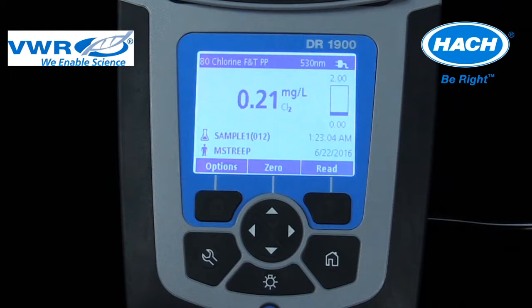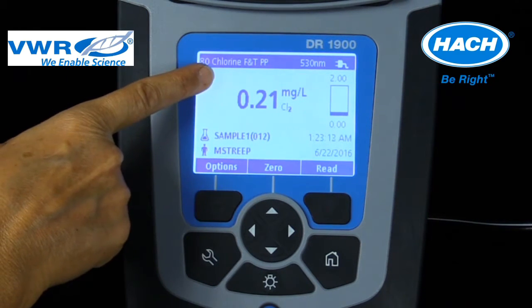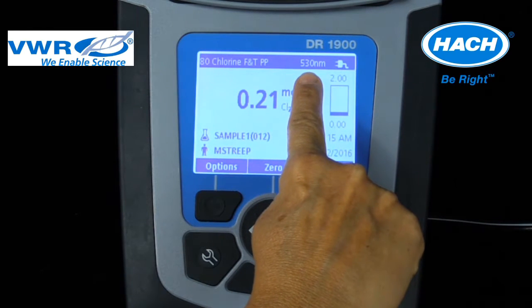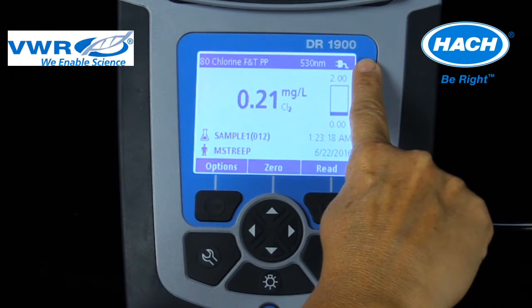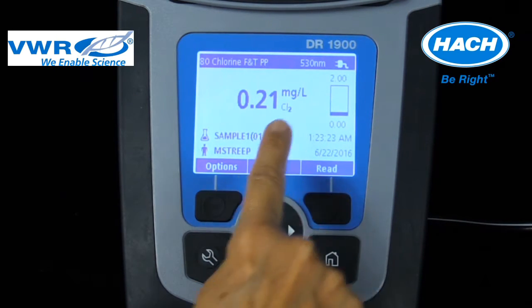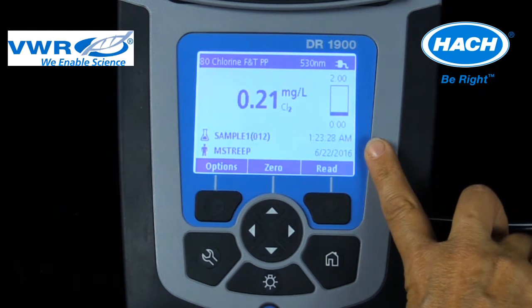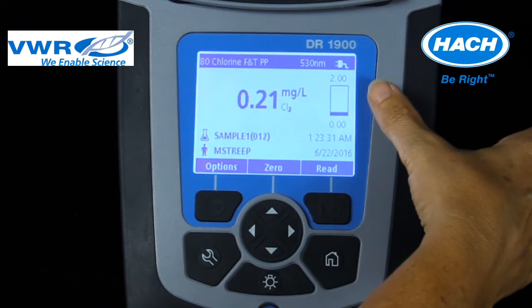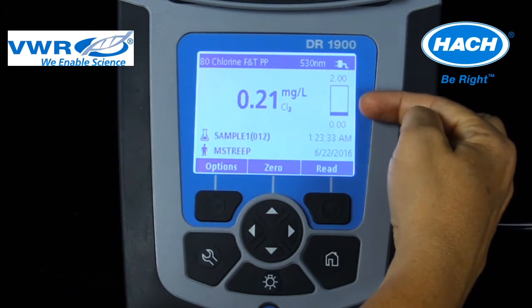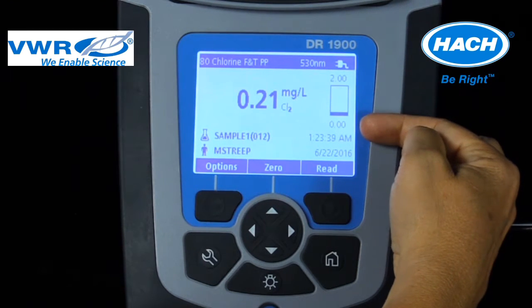The DR1900 displays the same measurement information as the DR3900 and DR6000 spectrophotometers. Information includes program number and parameter, wavelength, and power source, the measurement value, concentration in units, the sample ID and operator ID, and date and time. The control bar feature on the right hand of the display shows where this measurement resided within the total concentration range of the program.